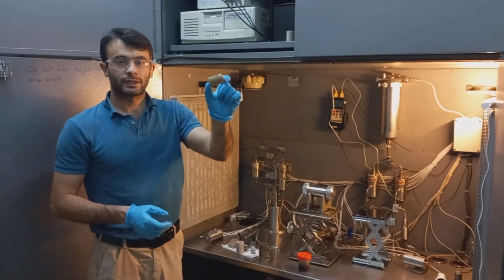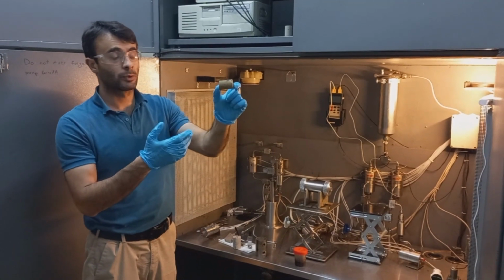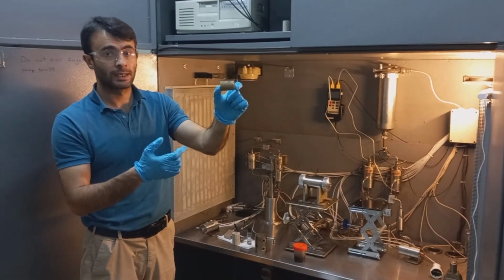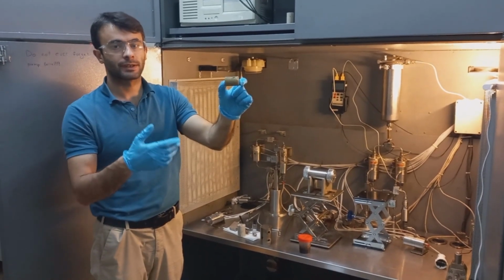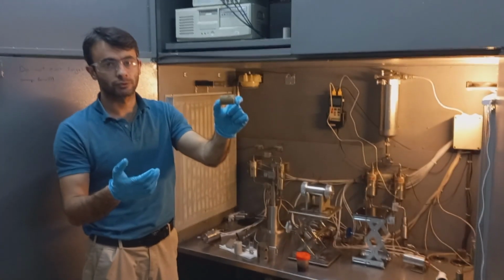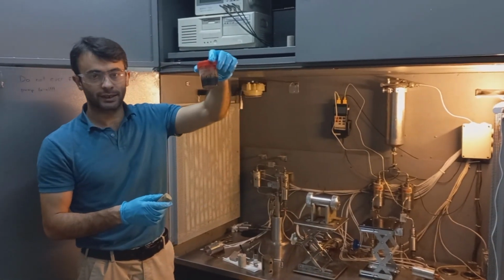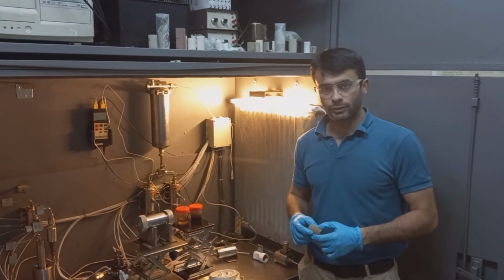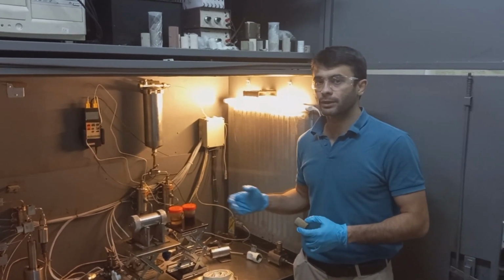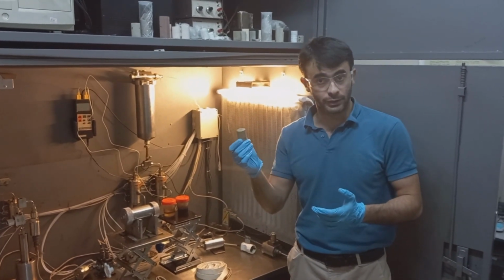We work with such rocks. For example, this is a sandstone sample which was saturated with oil. We can displace this oil by using water, surfactant, alkali or polymer solutions and measure how much oil can be displaced by using a certain fluid. Besides enhanced oil recovery, this equipment can be used to study the interactions between drilling fluids and rock samples.